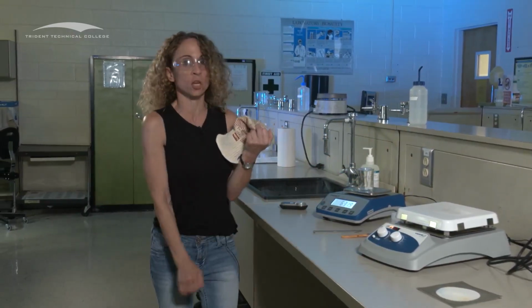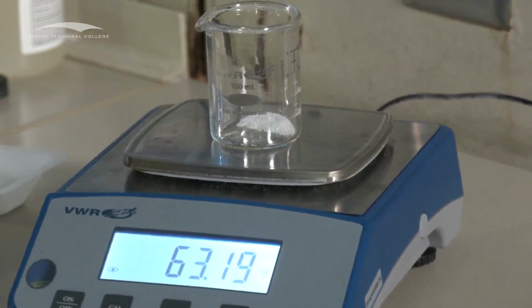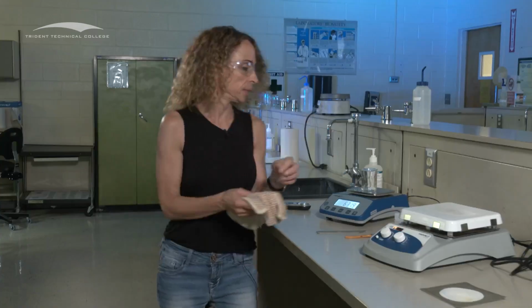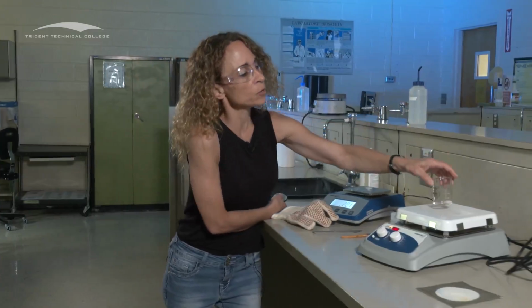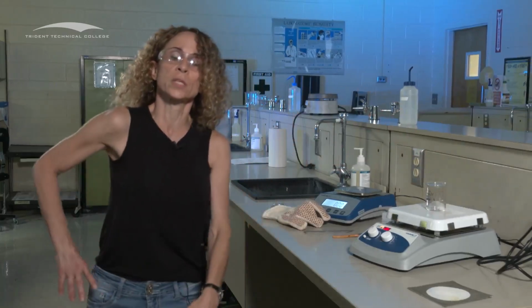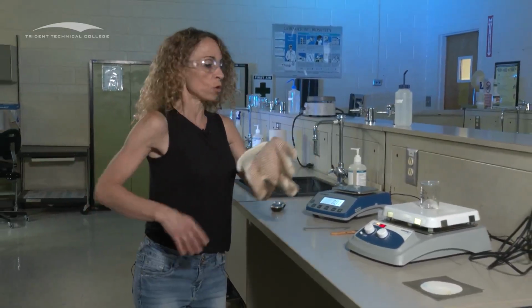Not adding any extra digits. And what is the units? Don't forget to put the grams. Done. Okay, so you're going to weigh this, you're going to record it. Now you're going to do this again. Put it back onto the hot plate for the specified time, which I believe is 5 minutes for the second cycle. After 5 minutes or the allotted time, you are going to do what?